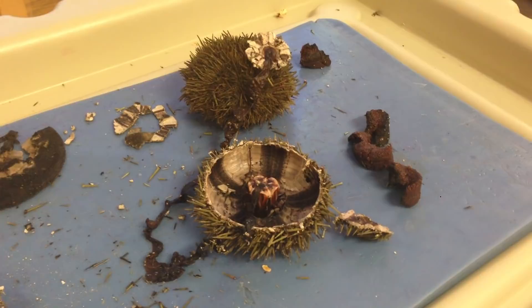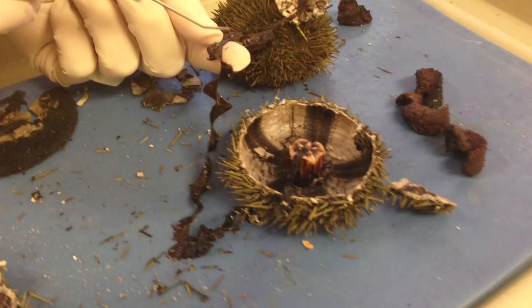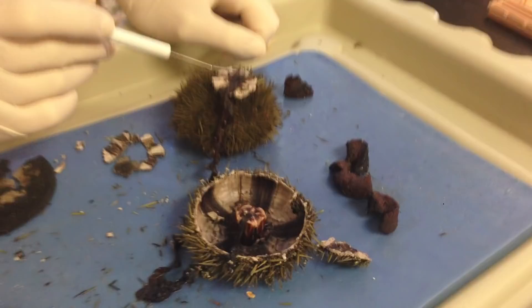Then you can look at the siphon of the intestinal tract, which is located next to the intestinal tract. If you look closely on the edge of the intestinal tract, there's going to be a little siphon. It's this little siphon right here — it runs right along the edge. You would have seen that in your pictures.